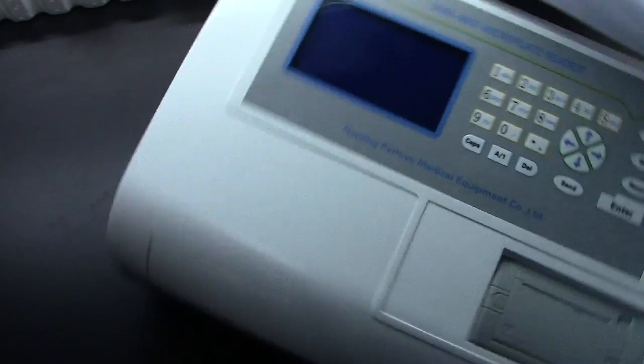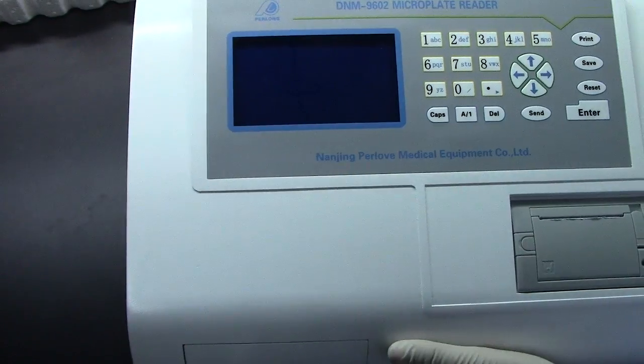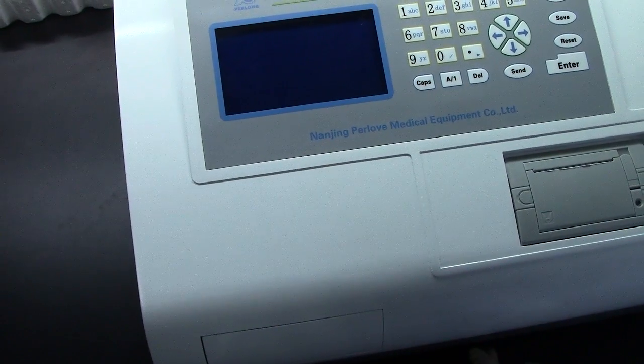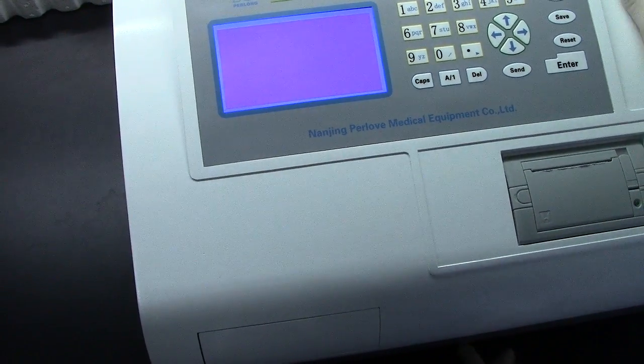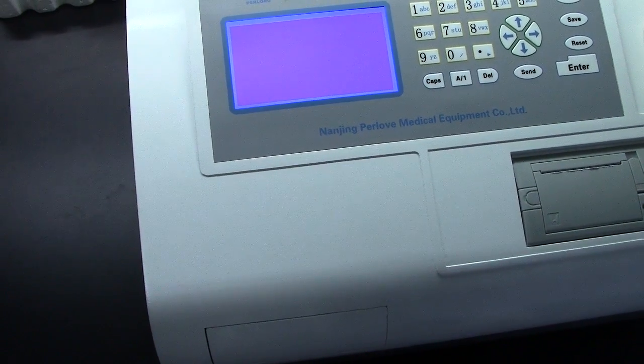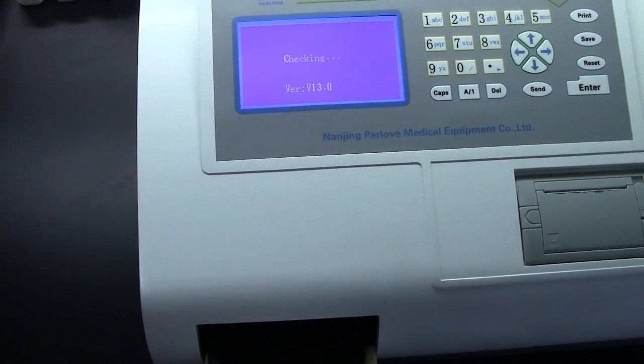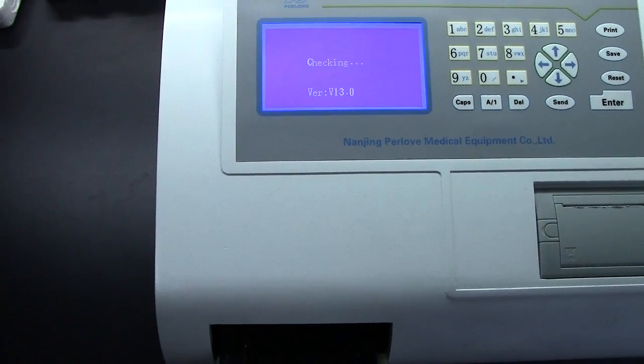Let's power on the device. It will self-check.